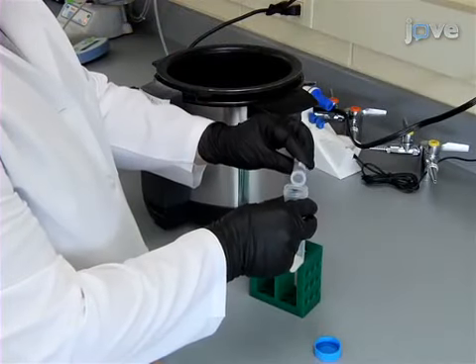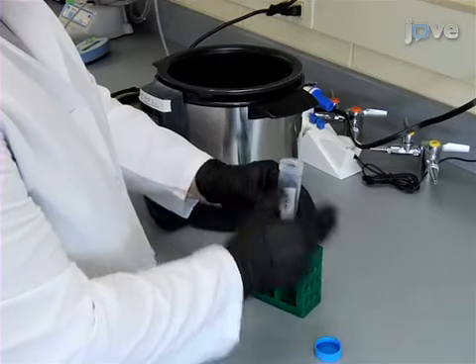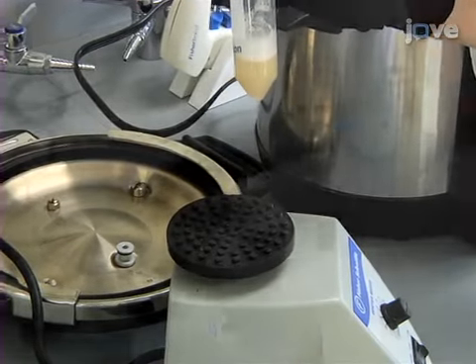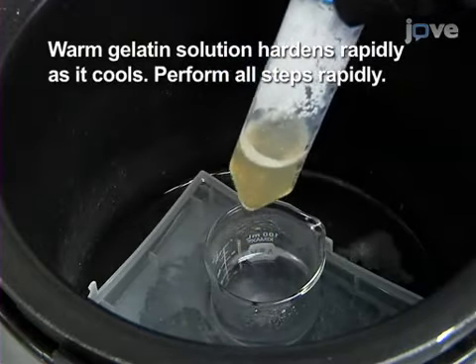Prepare a solution of approximately 175 milligrams per milliliter of gelatin in high-purity water. Mix the gelatin vigorously. After the solution has become viscous and difficult to manipulate, place the tube in a water bath at approximately 60 degrees Celsius, warming until the solution becomes clear and easy to aspirate.